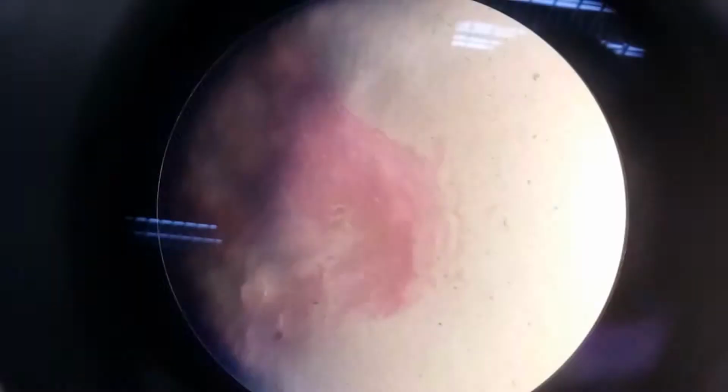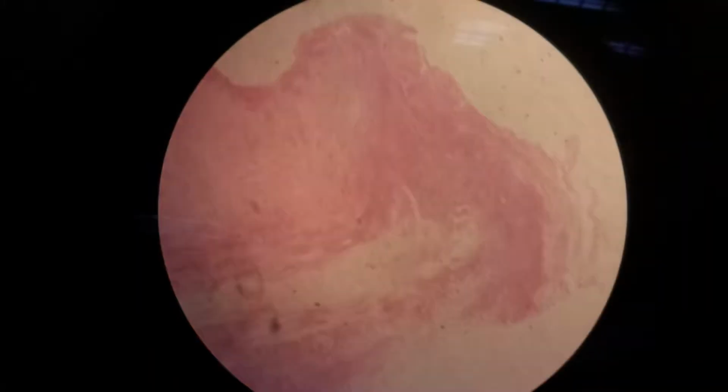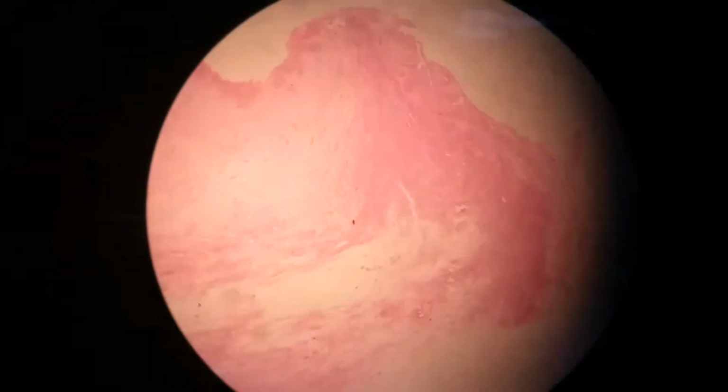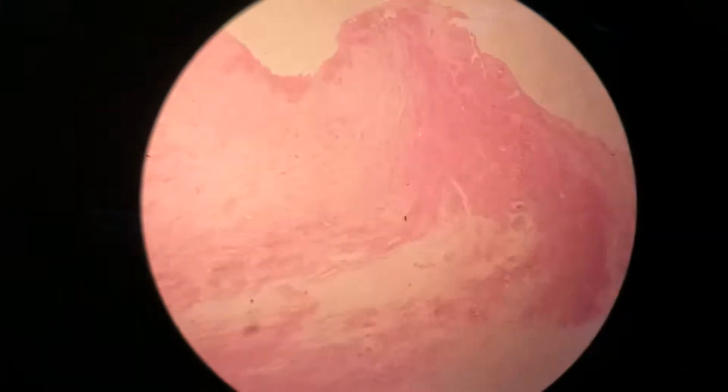Okay, the next slide is the slide of the human ovary. The ovaries, a pair of tiny glands in the female pelvic cavity, are the most important organs of the female reproductive system. Their importance is derived from their role in producing both the female sex hormones that control reproduction and the female gametes that are fertilized to form embryos.